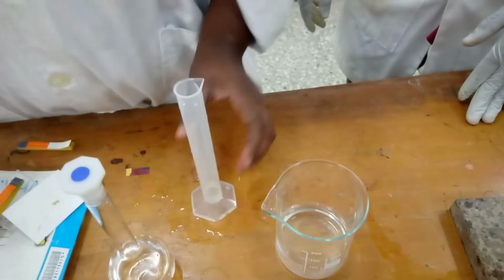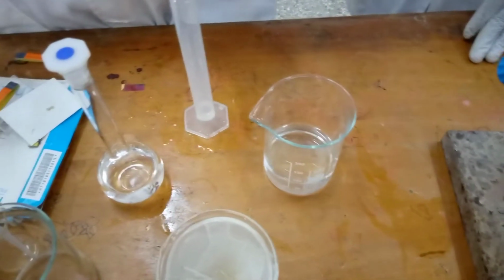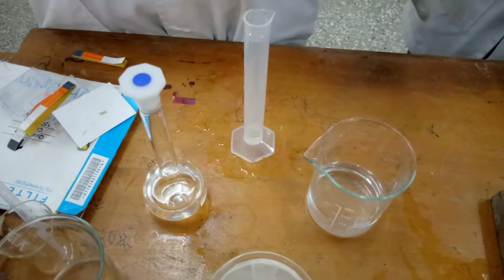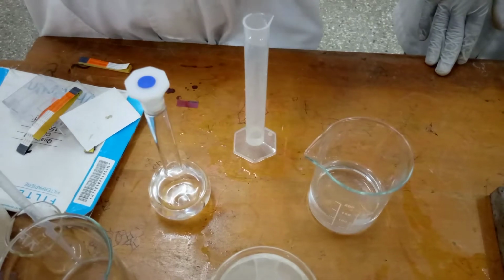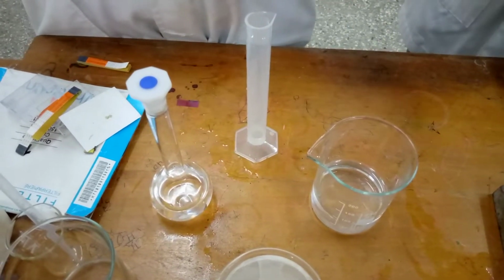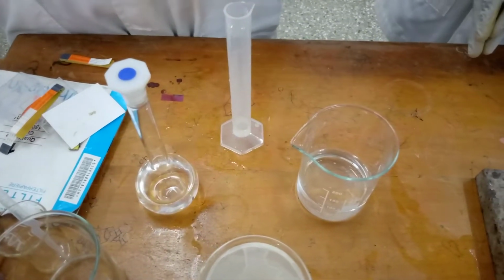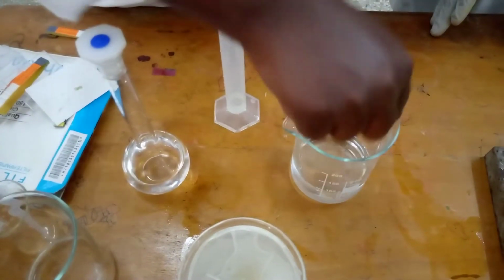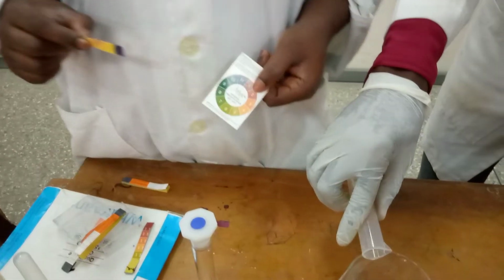Okay. So if I understand what we are doing, when we add the HCl, the chlorine will react with the sodium. Then the additional H of the HCl will be given to the benzoate? Sodium benzoate, yeah, so that it will come back to the benzoic acid that initially we started with. Oh, okay. So let me test it again. It's still basic, as you can see, pH 11. So we still add small, now small.